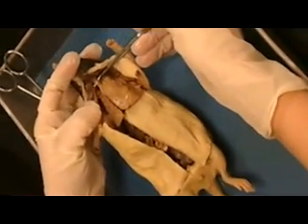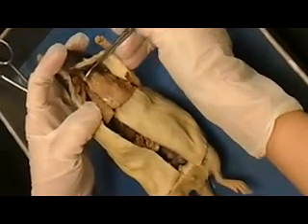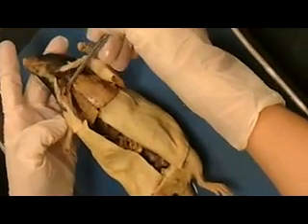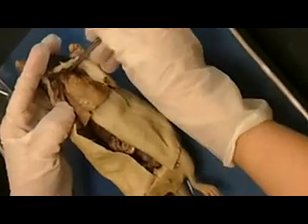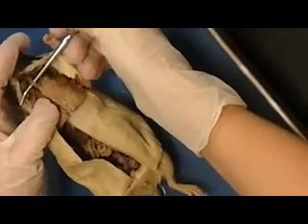Okay, today we're going to go through the parts of the rat. One of the first parts we're going to look at is the trachea. And if you notice, we're in the neck. Alright, so if you lift up this white structure right there on top of my probe, if you were to feel of it, you could feel little cartilaginous rings inside of it. It's rough, just like if you were to feel in your neck, you could feel them.